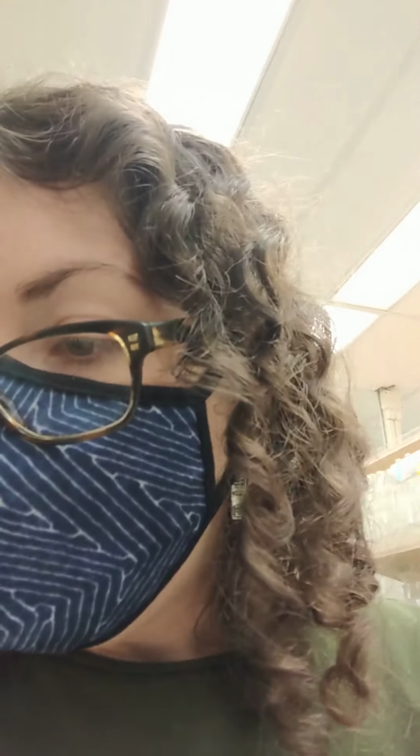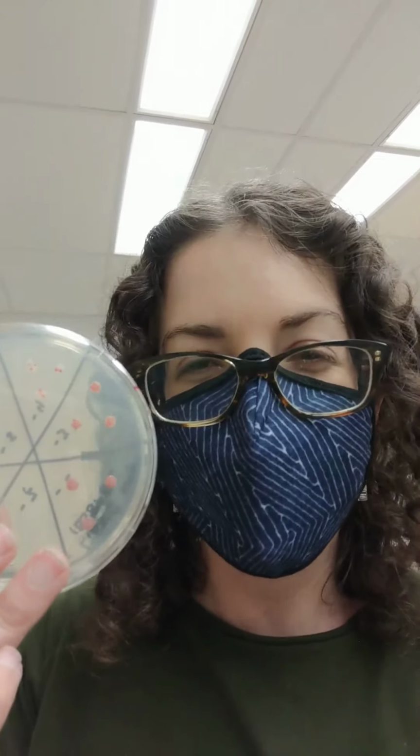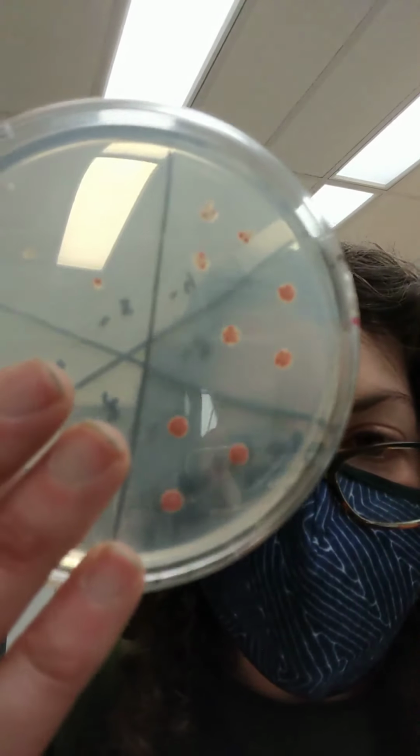And yeah, we're a bacteriology lab. We study the genetic determinants that help bacteria colonize plants and also survive in the environment. Our favorite organism is Ralstonia solanacearum, which causes wilting diseases of many plants. I've got some Ralstonia on my postdoc's plates, not actually mine. It makes these really beautiful goopy colonies. They'll actually drip onto the lids if you have them inverted, so they're really gross.